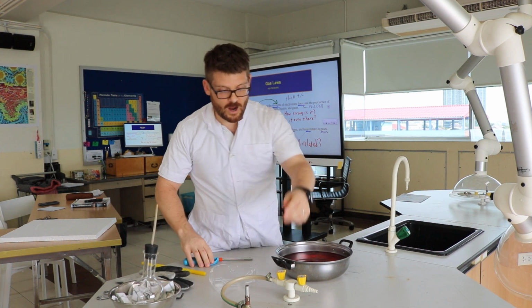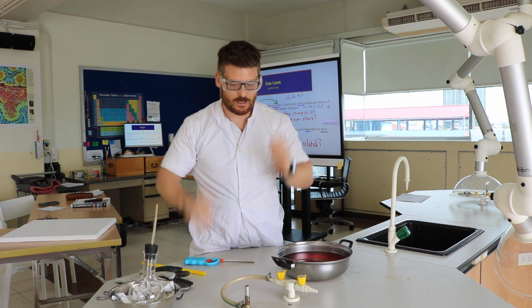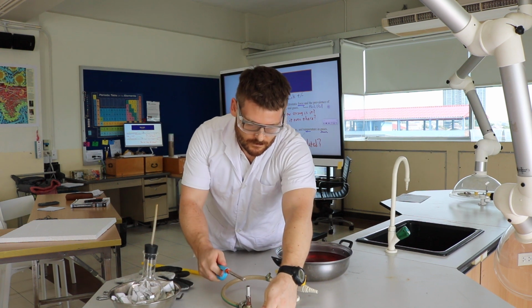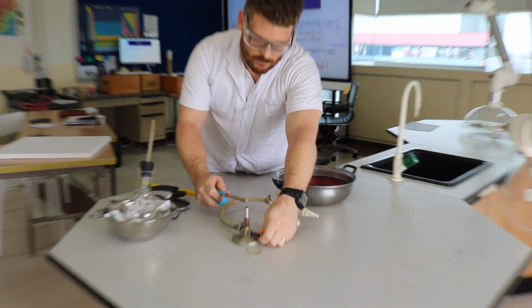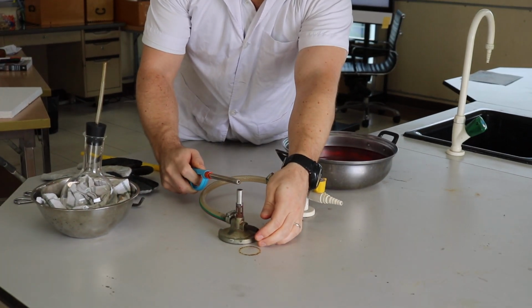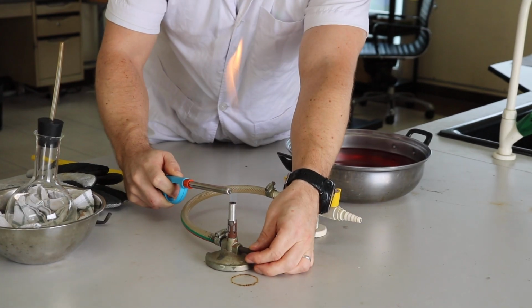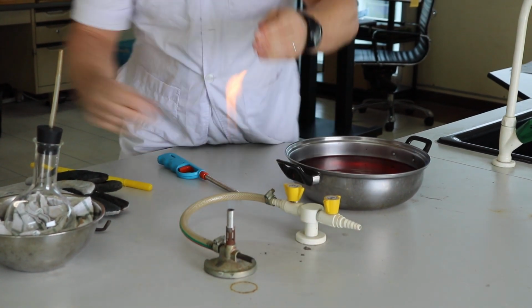Okay, I need some fire here. So first I'm going to put on my safety glasses. Gas on. Maybe. Maybe. Got it. Okay, so here we go.